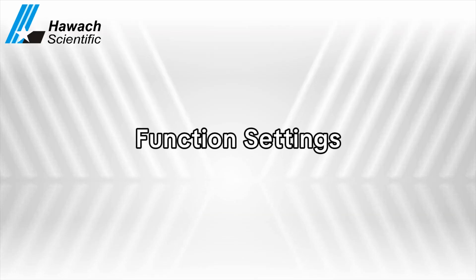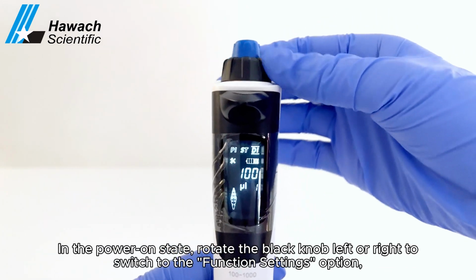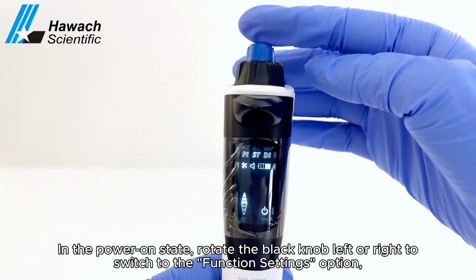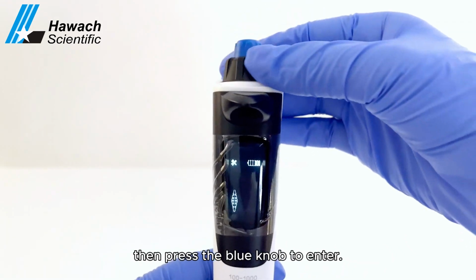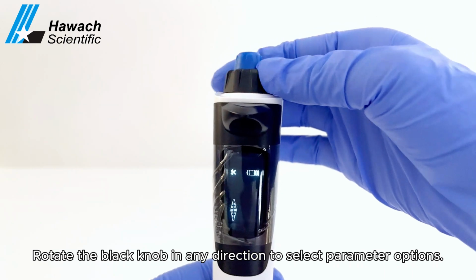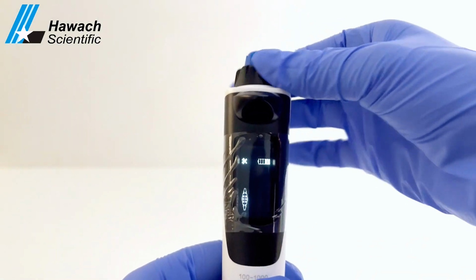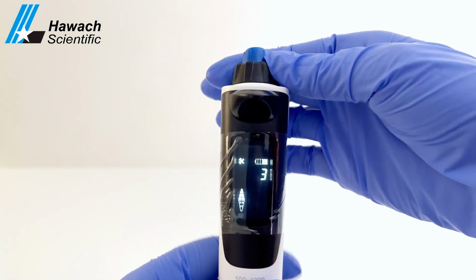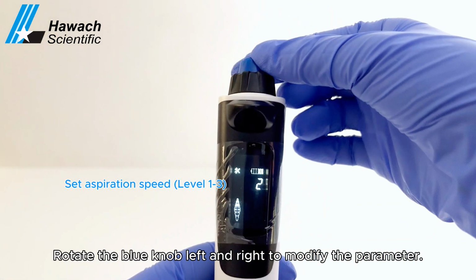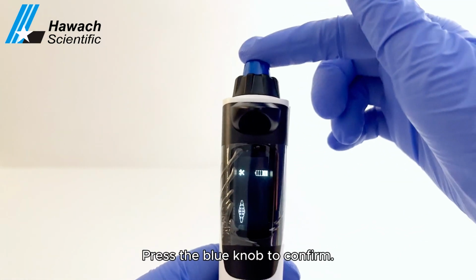Function settings. In the power on state, rotate the black knob left or right to switch to the function settings option. Then press the blue knob to enter. Rotate the black knob in any direction to select parameter options. Rotate the blue knob left and right to modify the parameter. Press the blue knob to confirm.